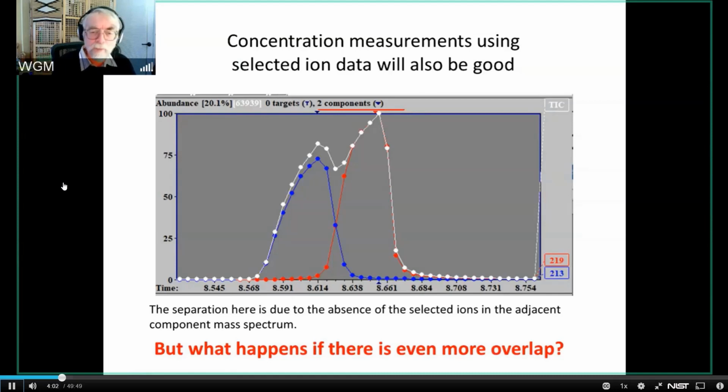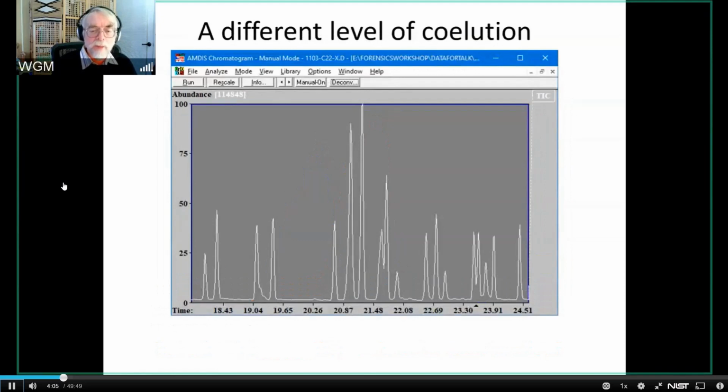And to do that, I'm going to bring up a data file that happens to be a group of pesticides, and this is a fairly small fraction of a much longer chromatogram. When you look at this data, it looks like we have some cases where there's something that looks like what I was talking about before as a co-elution here and here. And then you look here and say, well, maybe there's something going on there. I'm not really sure. Maybe that's got some bad chromatography there. But I want to examine closely two of these peaks. I'm going to start by examining this one, and then we're going to examine this one.